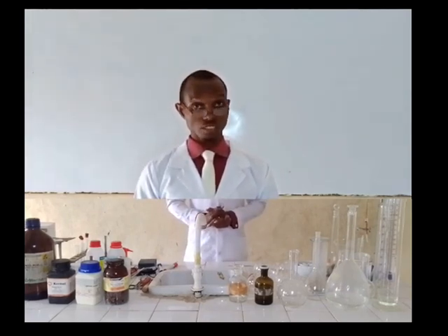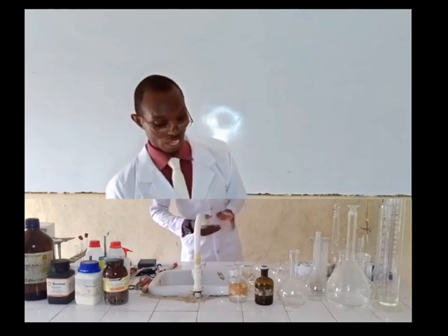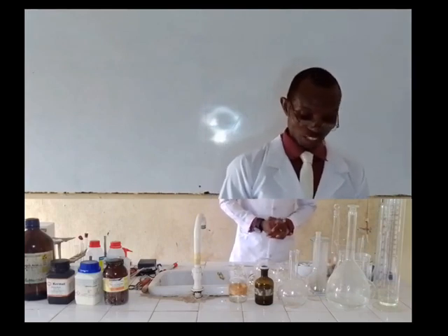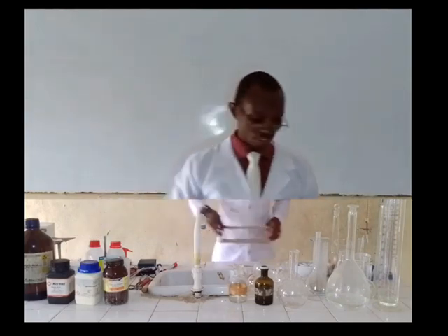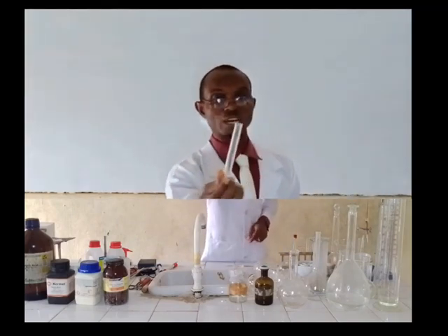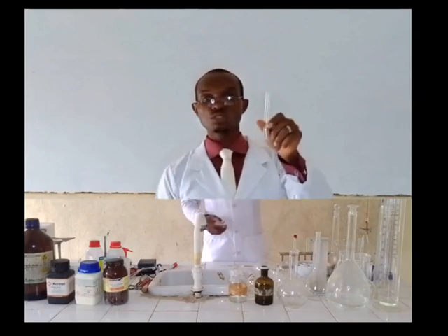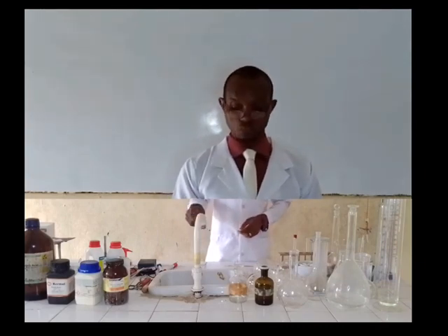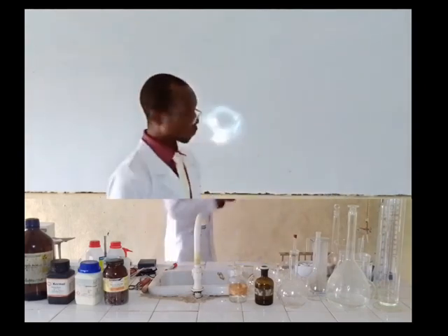For this introduction, we'll be starting with what we refer to as the glassware — instruments that are made of glass. First, I want to start with what we refer to as the test tube. This is what we refer to as a test tube. It is a cylindrical glassware that is hollow in nature, and it can be used to contain specimens or chemicals depending on what type of practical you are intending to carry out.